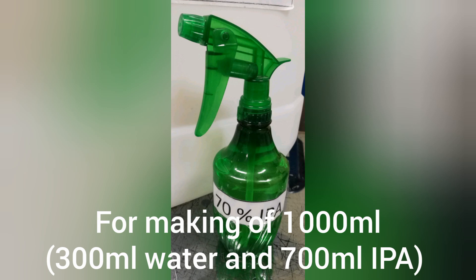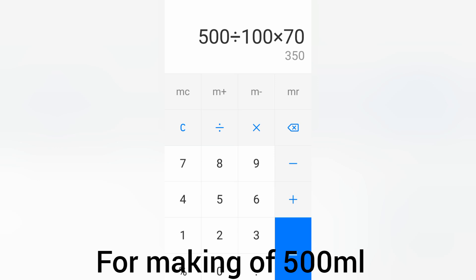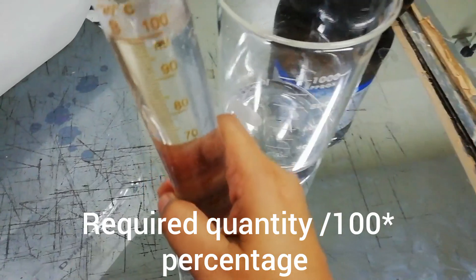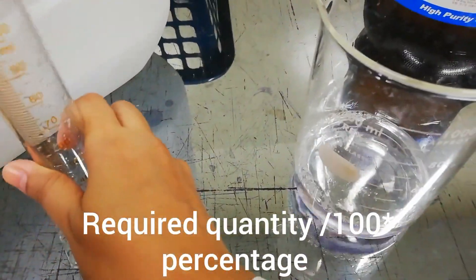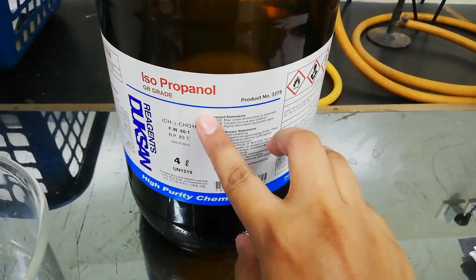For making 500 ml, divide 500 by 100 and multiply by 70 — that means I will use 350 ml of IPA and 150 ml of distilled water. I have added 150 ml of distilled water measured by cylinder, and now I will make up the volume with isopropyl alcohol to the 500 ml mark.